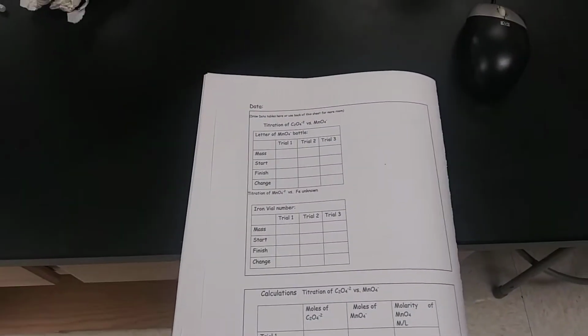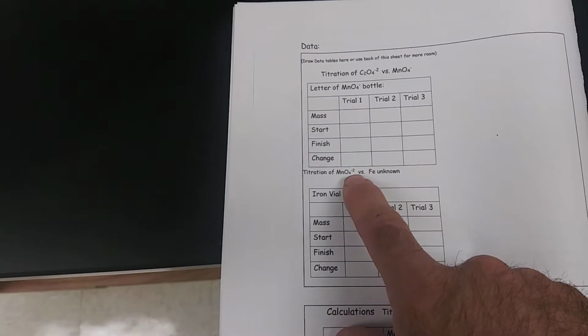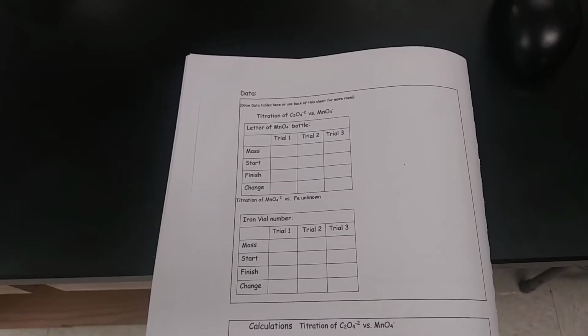All right? Start, finish, change. This is the burette volume on here. So make sure you know how this thing works. This is the trial to be able to figure out the change in permanganate, and then eventually the concentration of the permanganate. So be aware how the titration works.